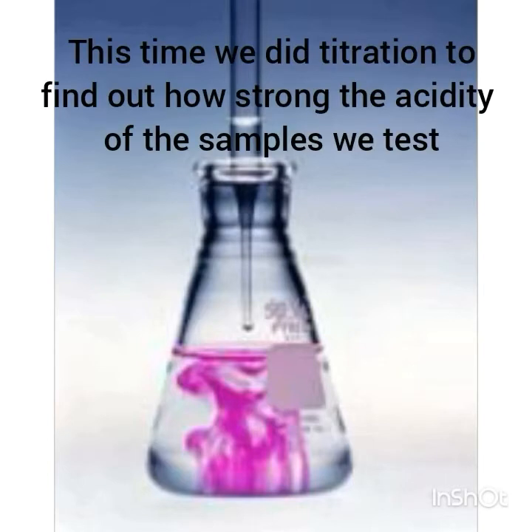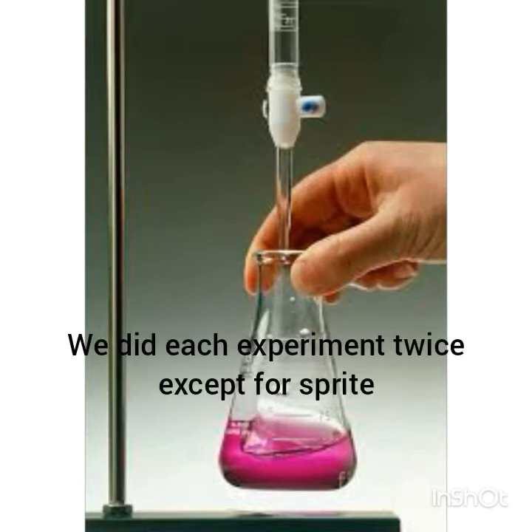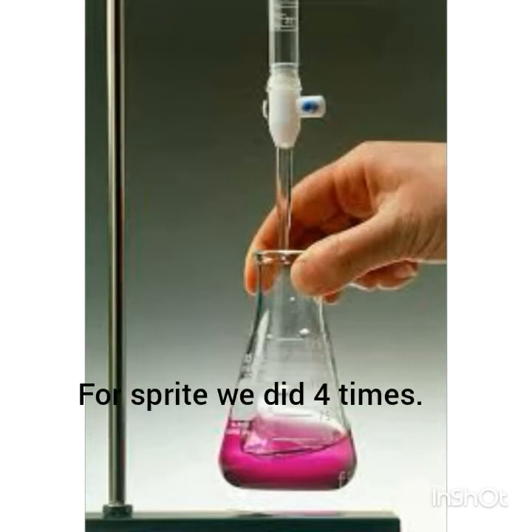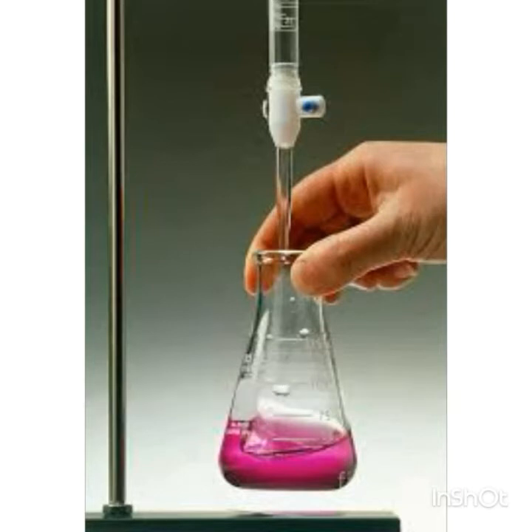We are back again with the second experiment. This time, we did titration to find out how strong the acidity of the samples were. We did each experiment twice except for Sprite. For Sprite, we did it 4 times because we failed the first 2 tries, sadly.